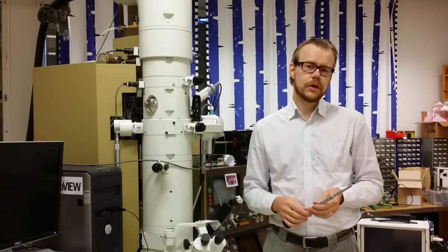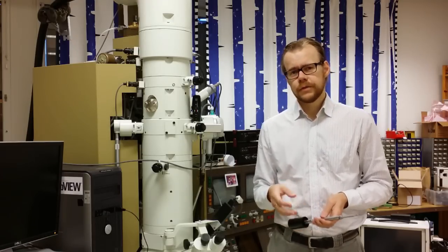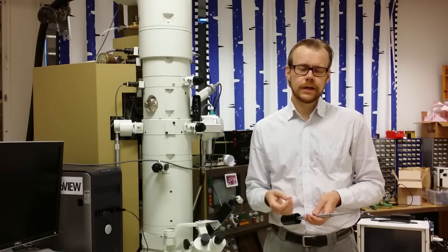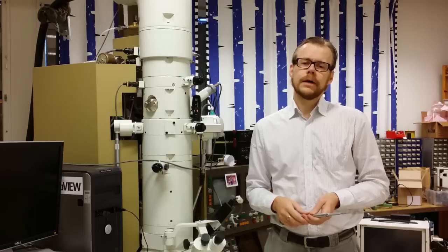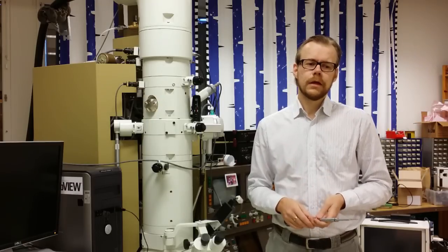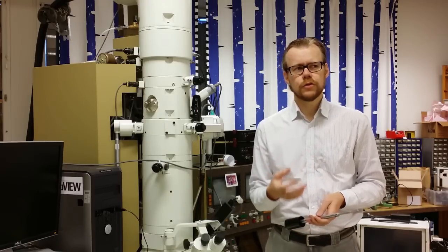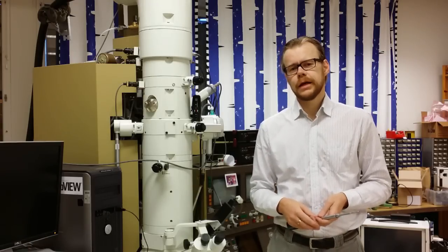I've already prepared two samples in the sample holder that we're going to study. One of the samples is molybdenum trioxide, and that is an orthorhombic crystal structure material. It looks sort of like a simple cubic structure, like a cube, but the side lengths of the cube are different — so it is not a straight cube. In order to know the lattice spacing of the crystal when we're studying it, we need to calibrate the system, and you do that by putting in a known sample. Today, that sample will be aluminum.